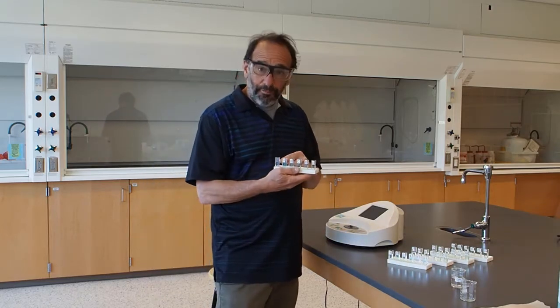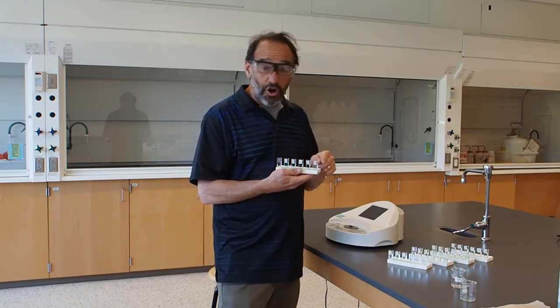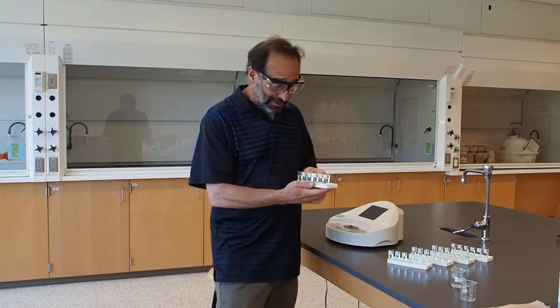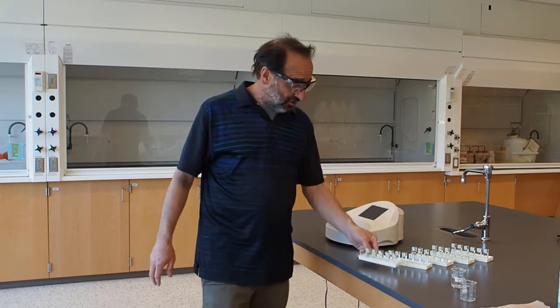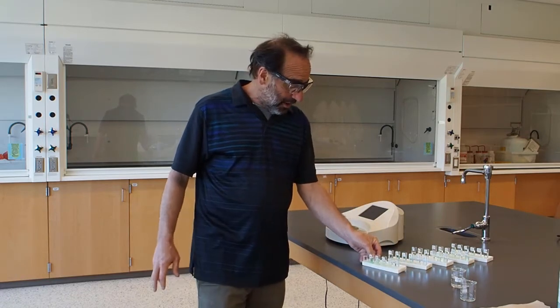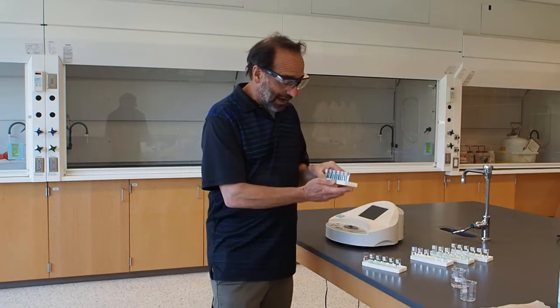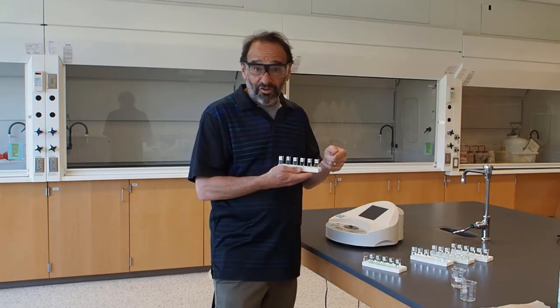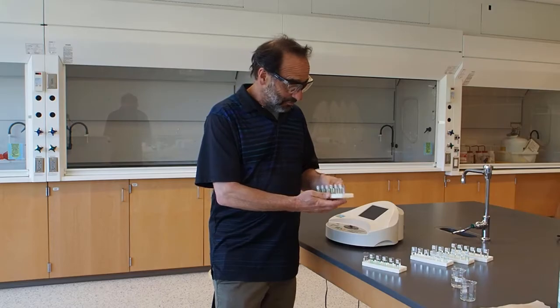First, we're going to do our blank and our five known-concentration standard samples. We'll do those first and then make a standard curve. After that, we'll analyze all 24 of our unknown samples. So it's time to make the measurements.